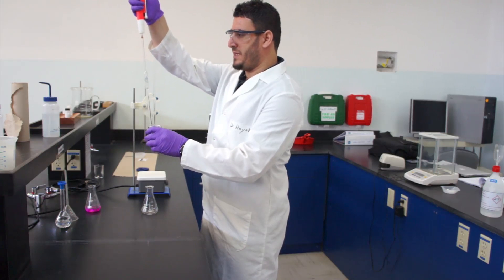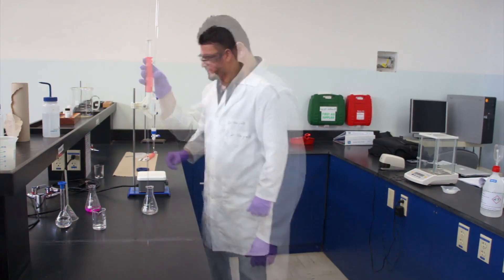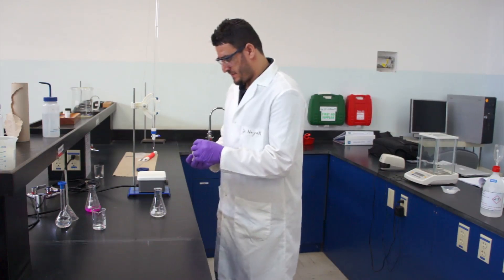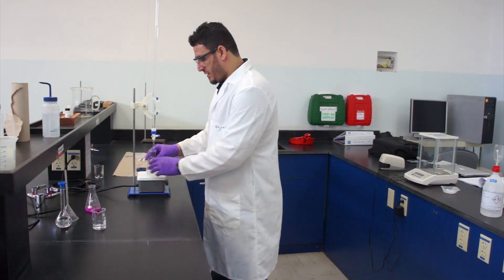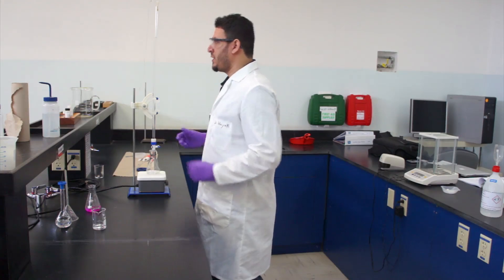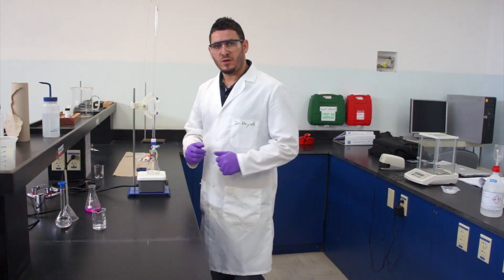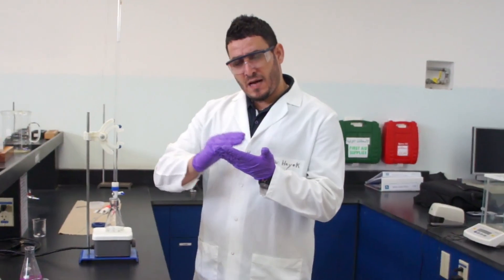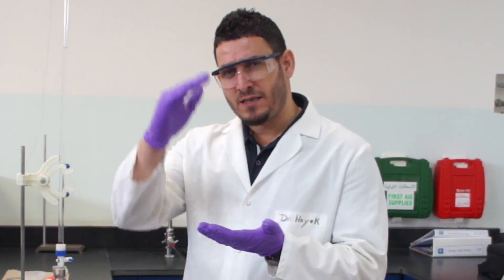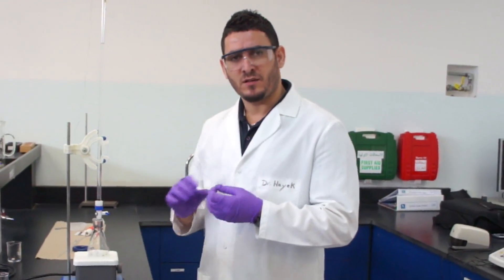Now I will repeat the experiment for accurate measurements. I take another 10 mL of the acid salt solution and add phenolphthalein — don't forget the indicator, it's very important. Since I know the endpoint is around 8 mL, I'll first add 6 mL all at once, and from there add dropwise while monitoring the color change.